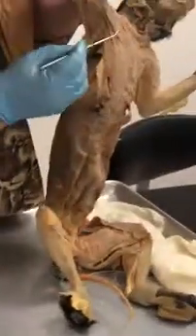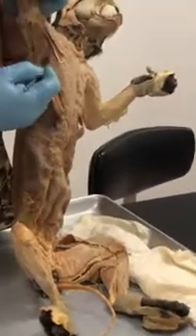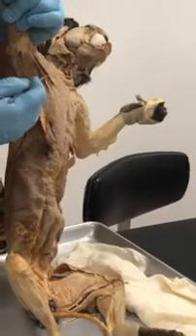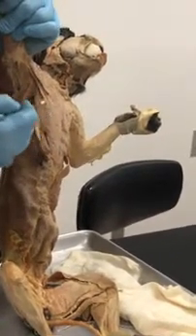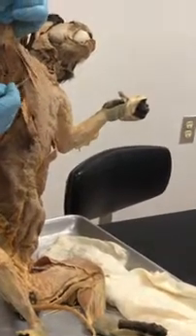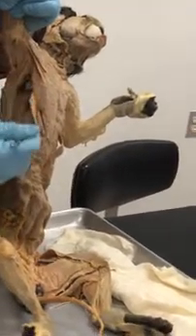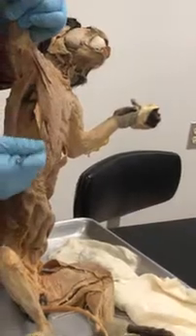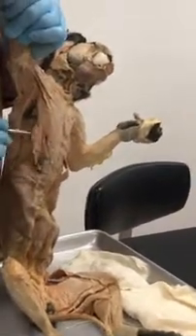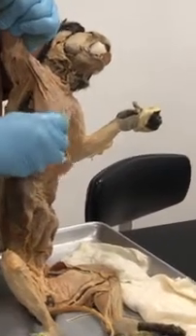Okay. So it's not dissected on the other side, but over here, this muscle looks like a bar. That's the pectoantebrachialis. Then you have the smaller one over here. That's the pectoralis major muscle. Then you have this large thing over here that kind of has this shape. And this is the pectoralis minor muscle, bigger than the major. And then you have this that goes from the xiphoid process to the humerus. There's one here, and on this side it's over here.